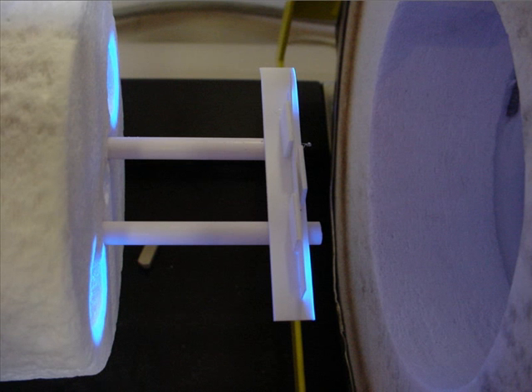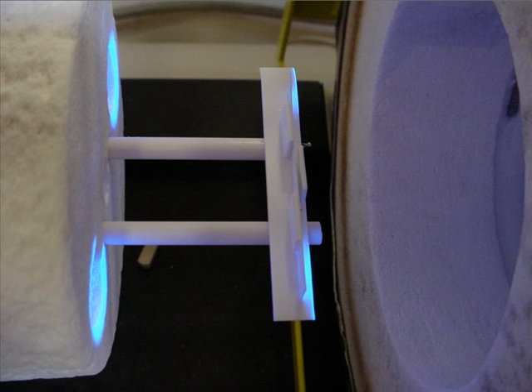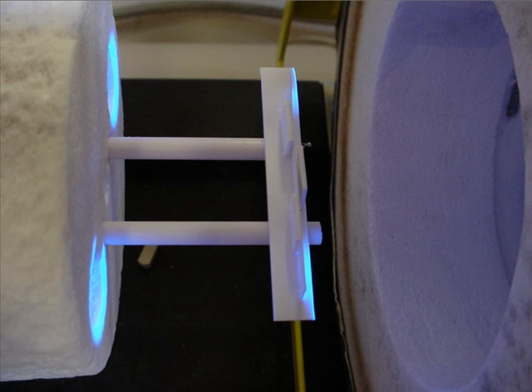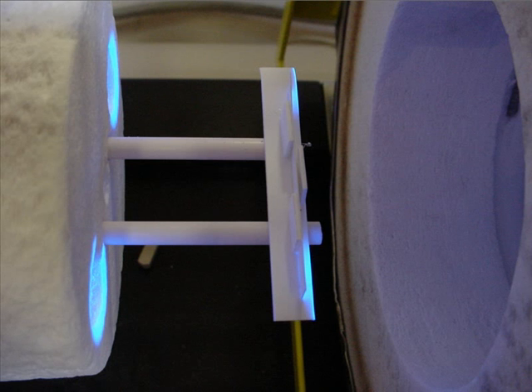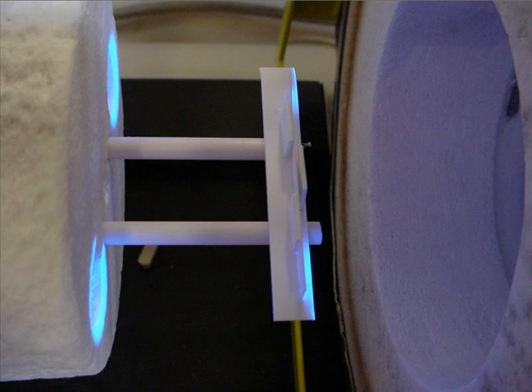The sheet is positioned on the sample holder for thin materials. The sample holder is then set on the two rods in the center of the kiln. The sample is free to move inside the sample holder, and the two sides are lighted by the two beams of blue light.